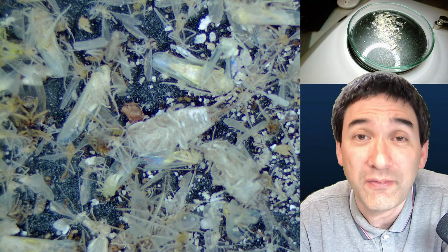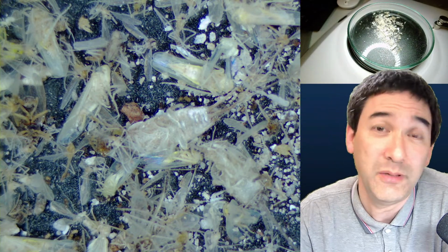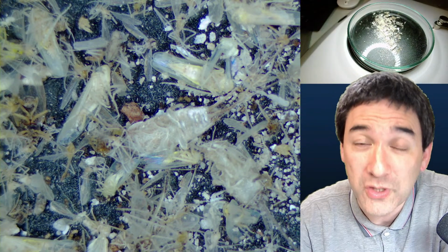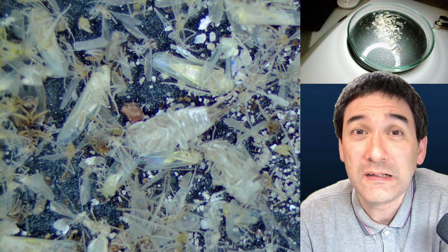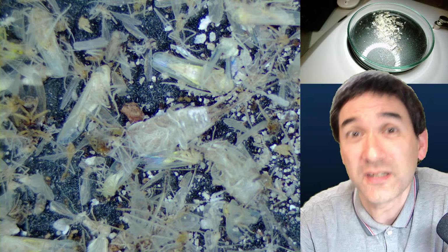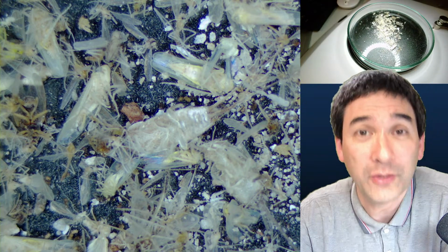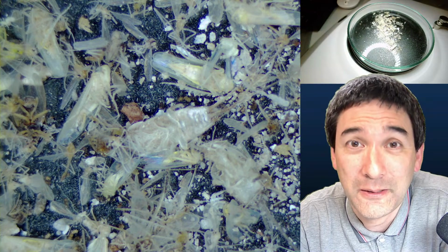These are quality devices and not so expensive, and they give you a lot of value. And you can find a lot of spare parts for those. So basically, used microscopes that are refurbished. That's the second strategy, right? Third strategy is just basically go out on Amazon and buy yourself something, right?